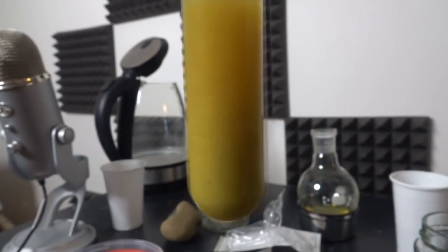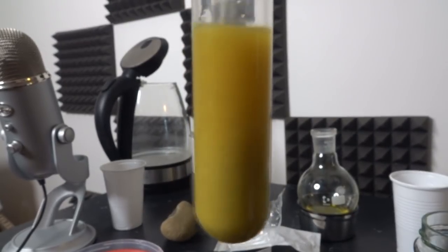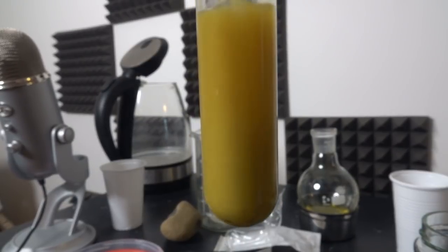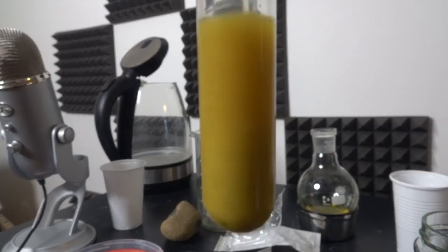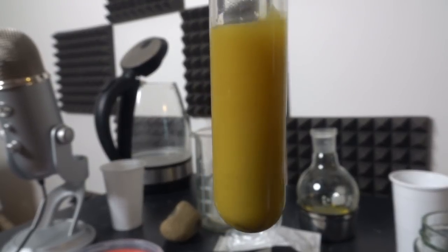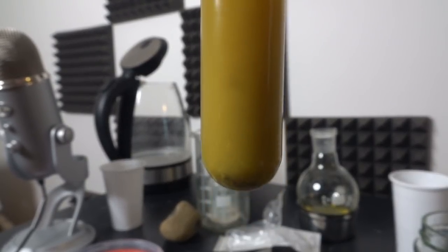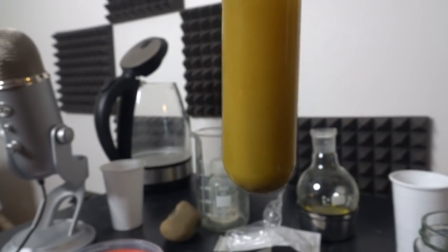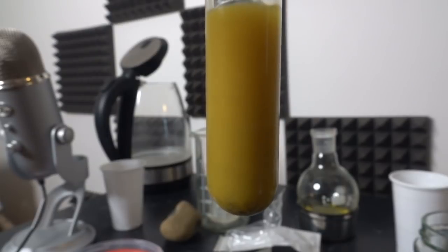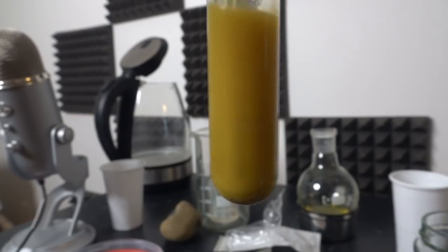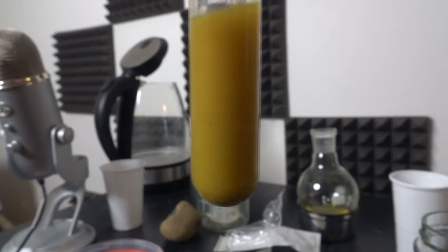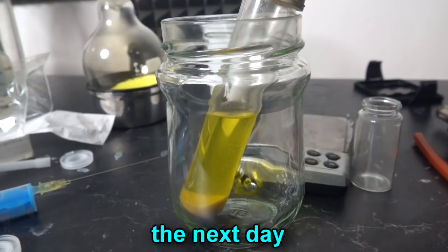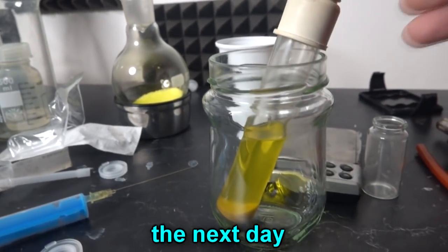So beyond this I'm going to let that settle out, stir it a few more times, let it settle out, and then I'm going to transfer all of this over and wash it once with water. You can see not much powder at the bottom, and that powder will be some insoluble rock-like stuff. It looks like that all dissolved up fairly nicely.